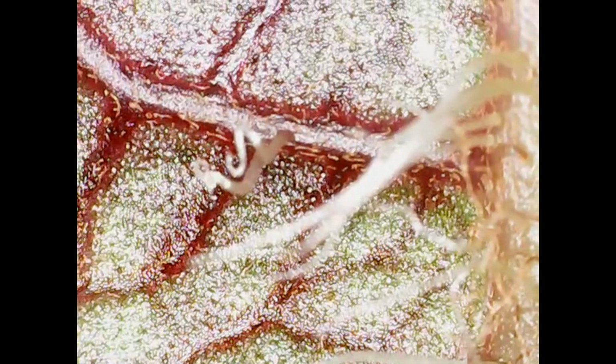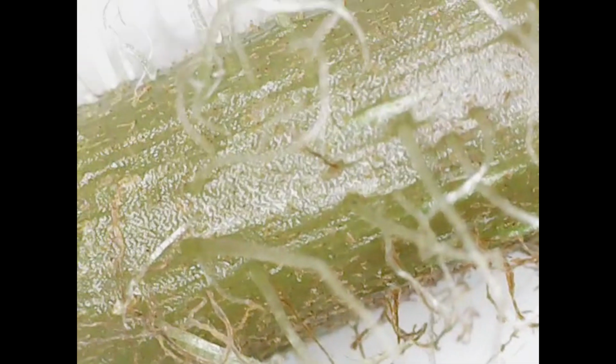They're not really hairs, they are growing actually out of the stem itself, or the midrib. Here you can see the same structures coming out of the petiole. So again, this is what's attaching the leaf to the actual stem itself. And it's really cool because they almost look like they're transparent here. And these ones specifically do almost look a bit white when they're not under the microscope. The ones we were looking at before under the leaf are slightly on the redder color.